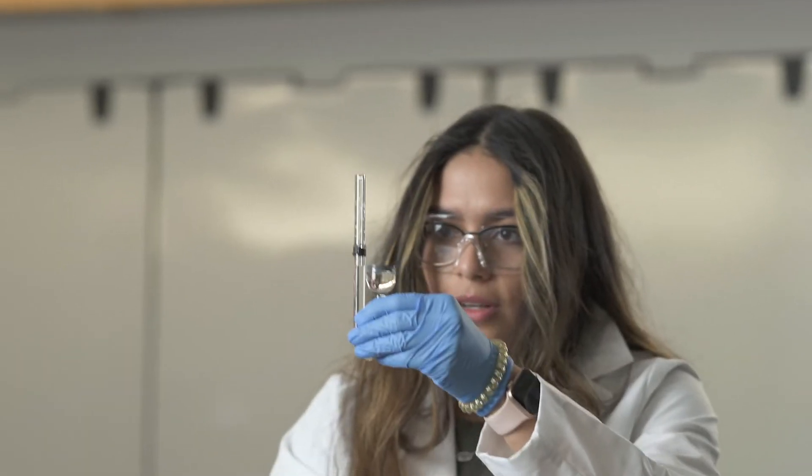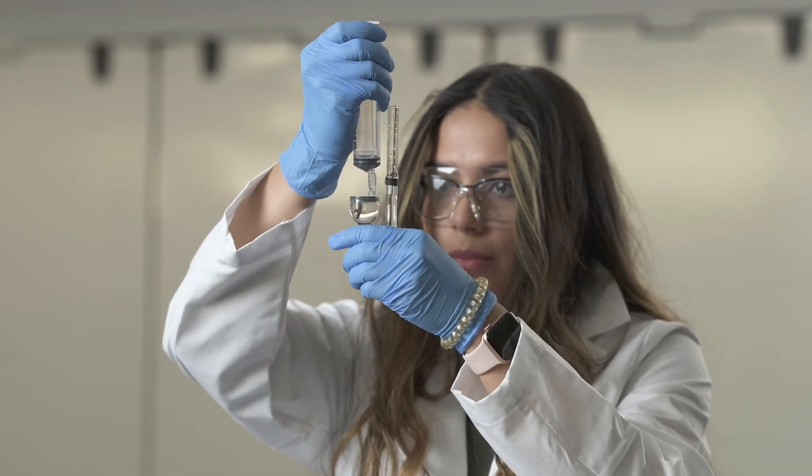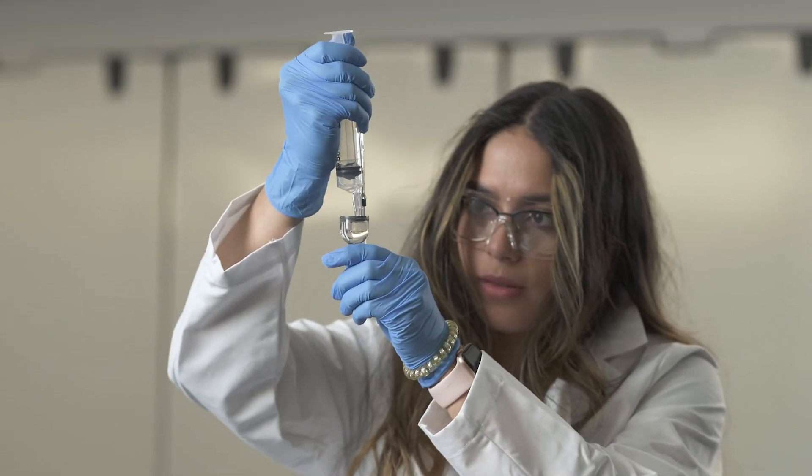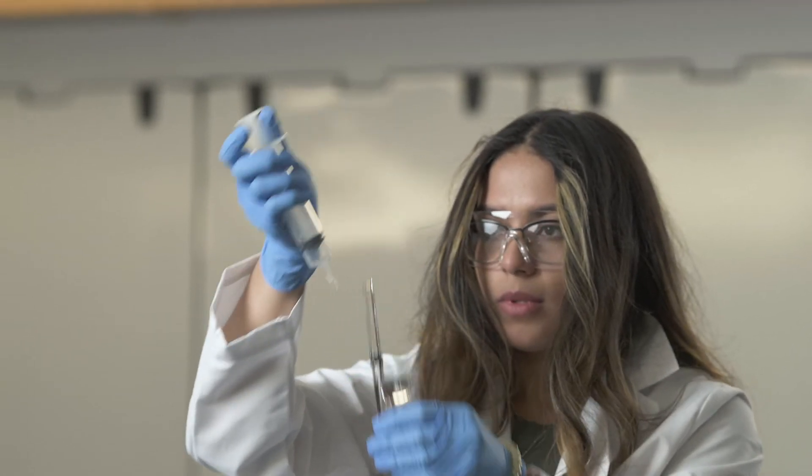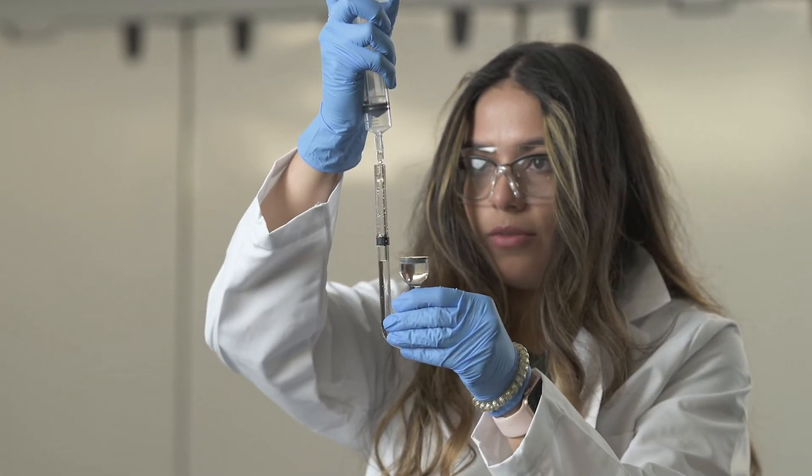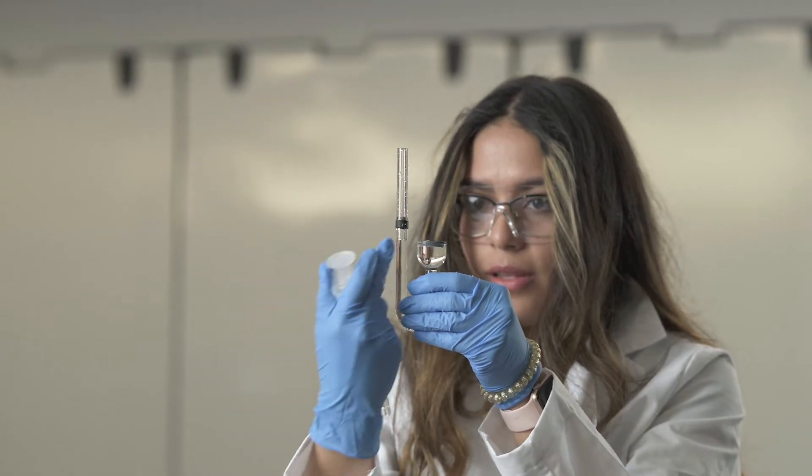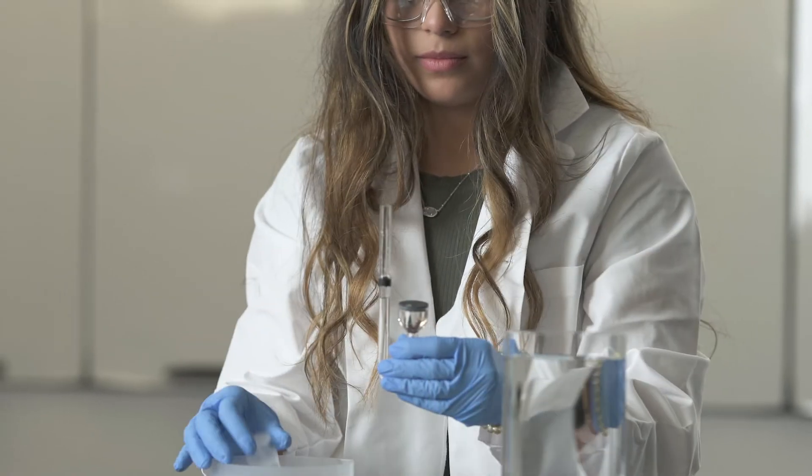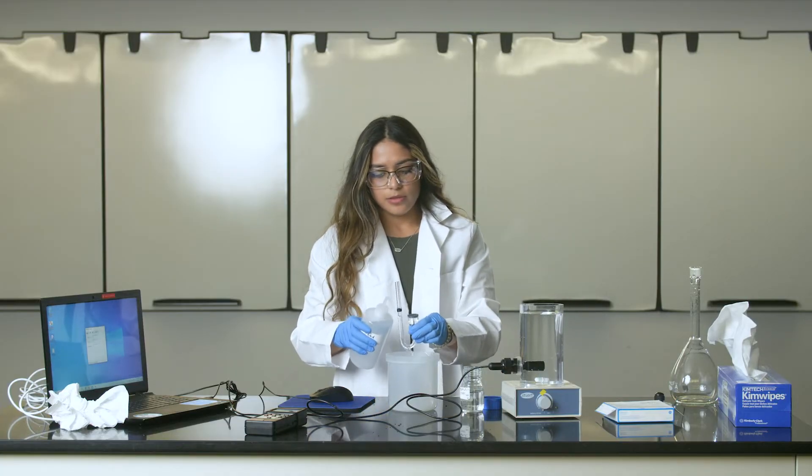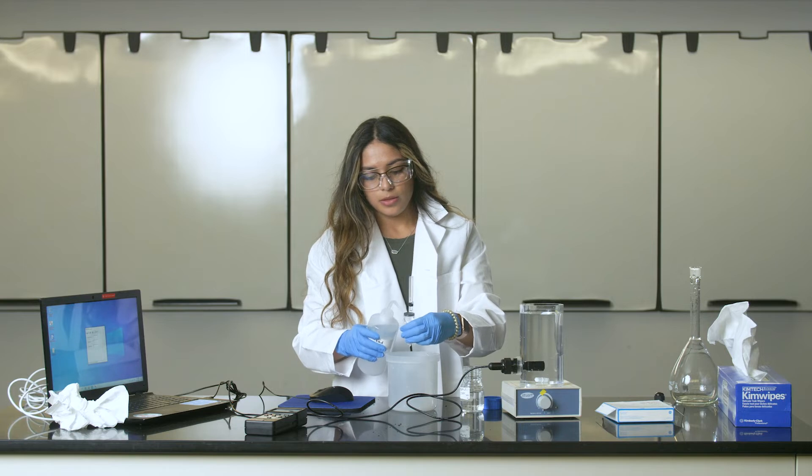You'll want to check if there are any air bubbles and remove them like this. Fill the solution until it lines up with the top of the diffusion cell, and then rinse the outside of the diffusion cell with pure water.